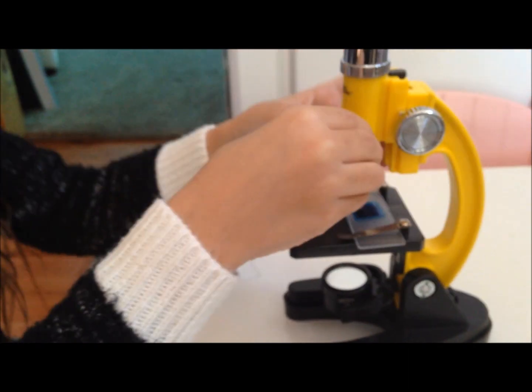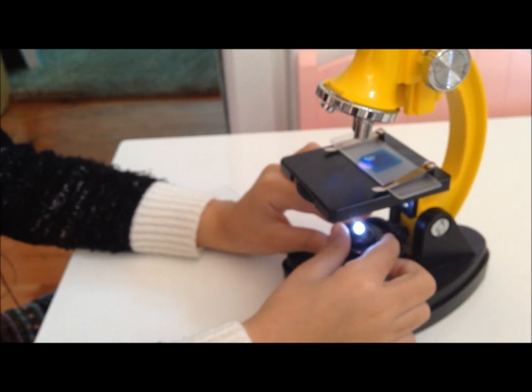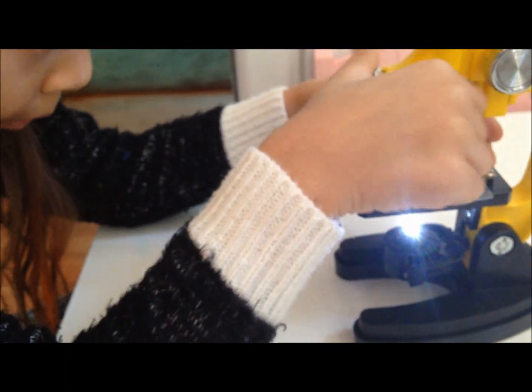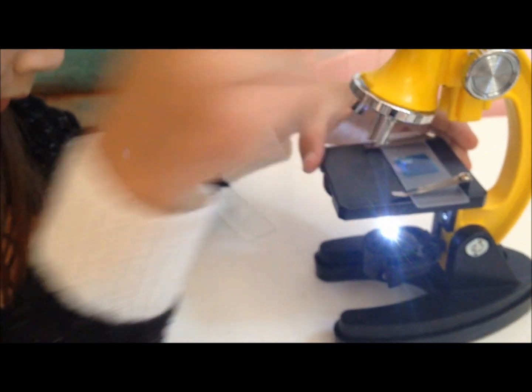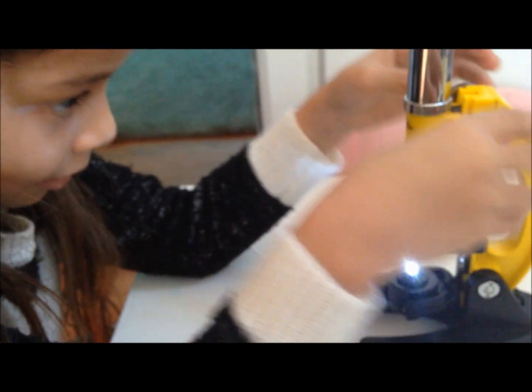Good job. Now we turn it on. I believe now you turn it on. That's how you turn it. Like that. And start with the low magnifying — the lowest, low lens. And then lower it down. You need to look in there, sweetheart, and see.